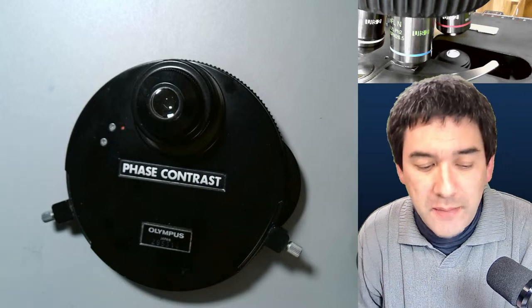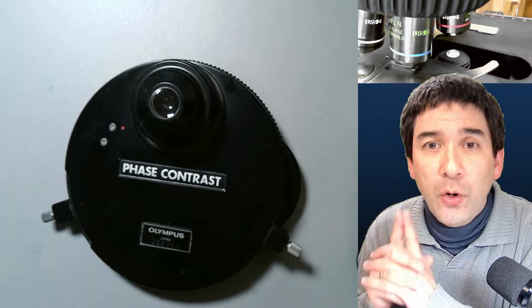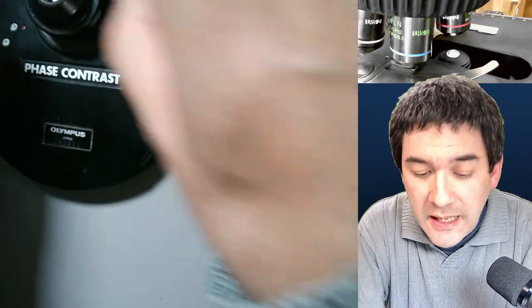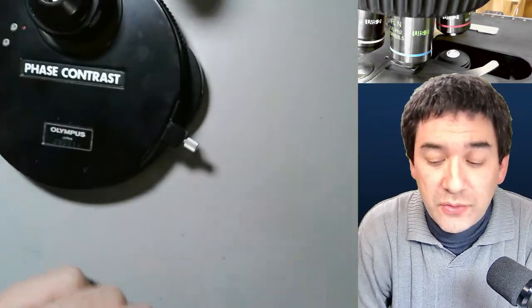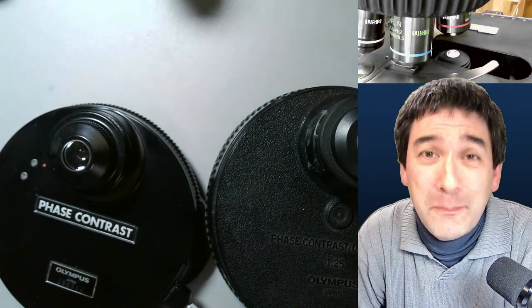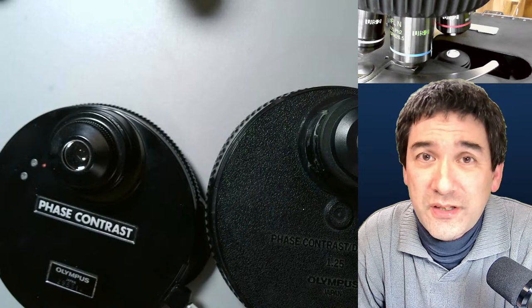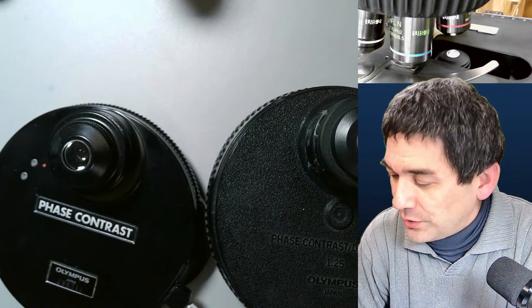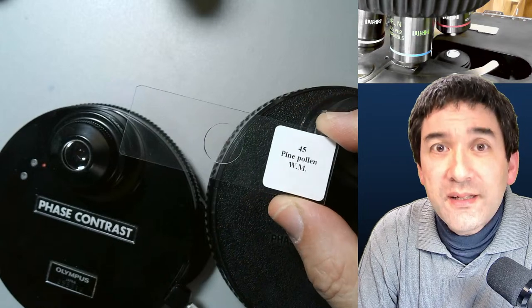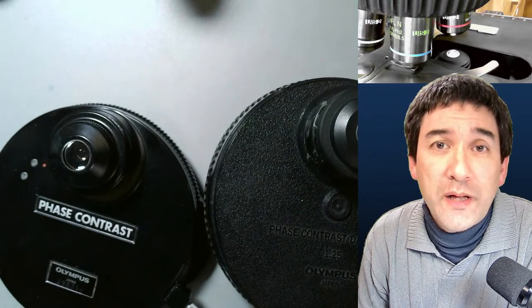Now I'd like to make a couple of specimens and show you in comparison how phase contrast looks under the microscope. I only have one phase contrast objective — a 40x — but that's enough for our purposes. I also want to illustrate that phase contrast is not the best technique for all specimens; for some specimens there isn't a big difference, and sometimes it actually looks worse.